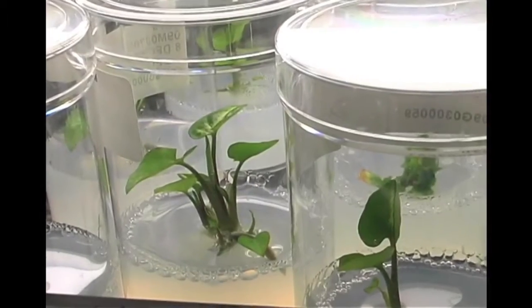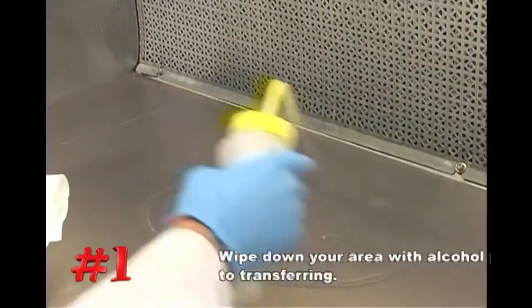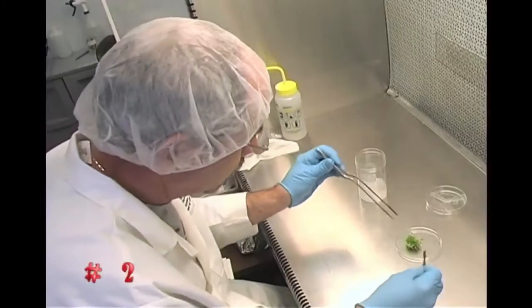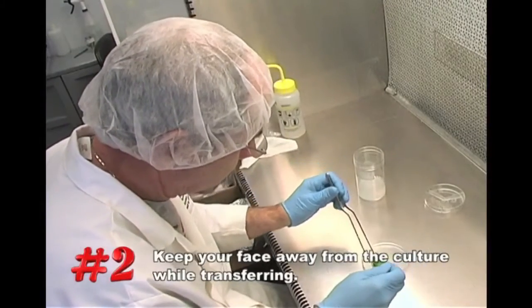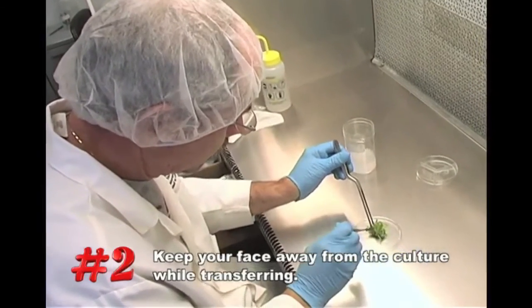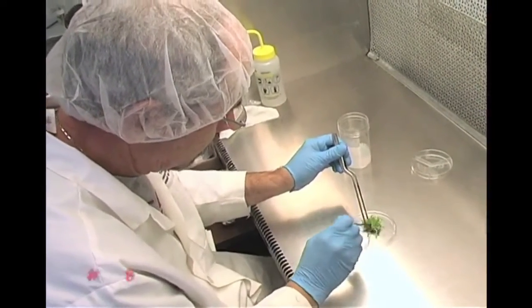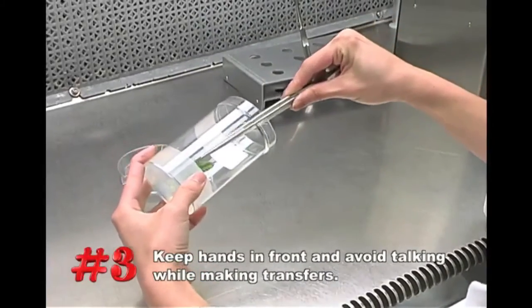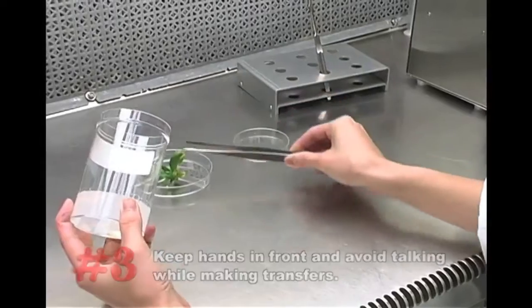To recap, 1. Always spray or wipe down the transfer area approximately 30 minutes prior to work. 2. Always keep your face and head away from the cultures you are transferring. Remember that most contaminants are introduced through poor technique. 3. Work with your hands in front of you. Avoid talking with others around you when making sterile transfers.